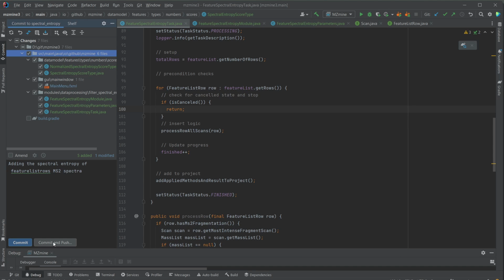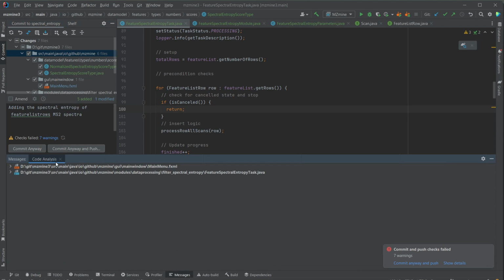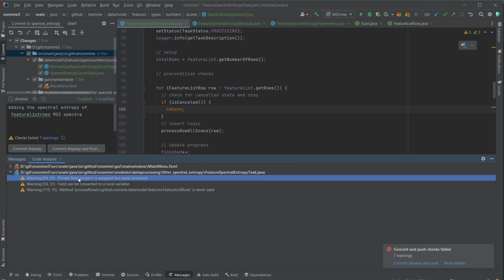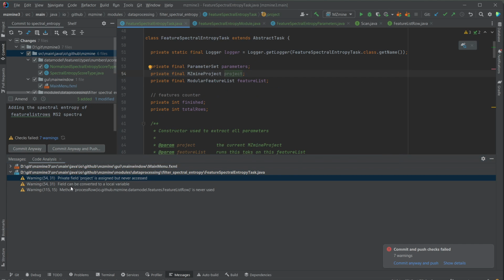And if I now just do commit and push, it's first going to tell me there's some warnings. Warnings are kind of okay. If there are some errors, I definitely have to address them first. But it's still good to look into those warnings. And of course, because we also changed some other code that's already been there, maybe those warnings are not going to be so important. The first warning is, for example, that the project is never used.